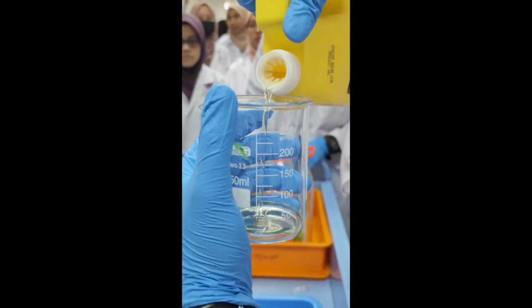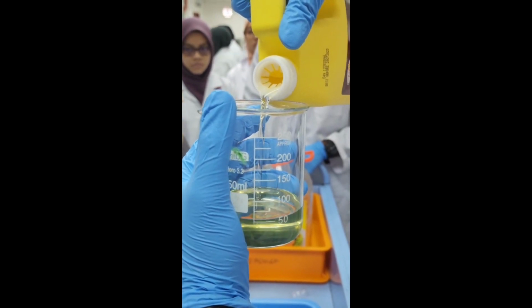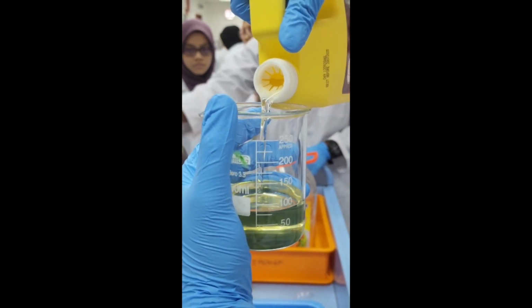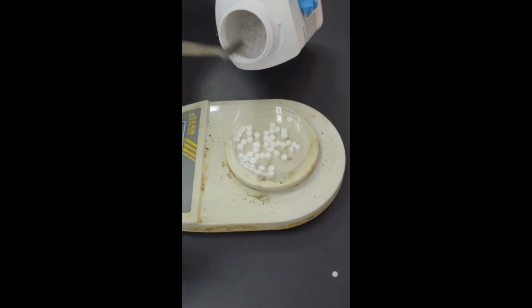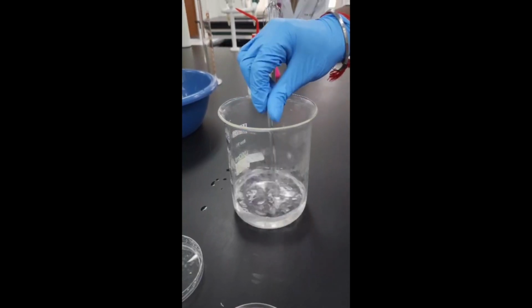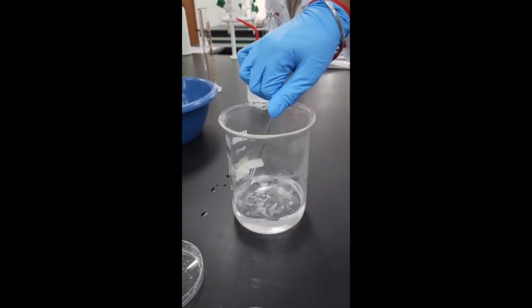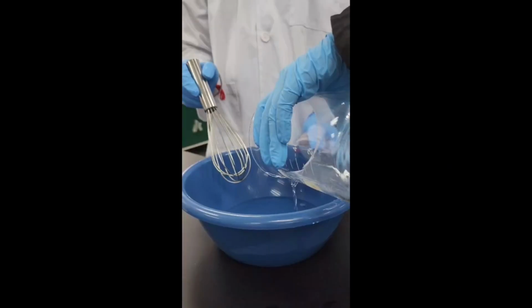The third step is that in a beaker, cooking oil and coconut oil were added. NaOH was then added into the beaker and constantly stirred for 30 minutes until the solution started to precipitate yellow colored solid. The fourth step is that food coloring, essential oil, and 80 ml of water were added and stirred continuously.